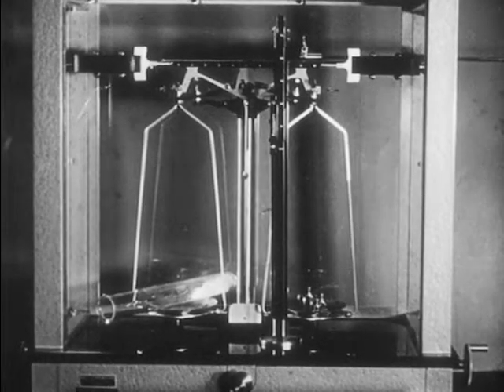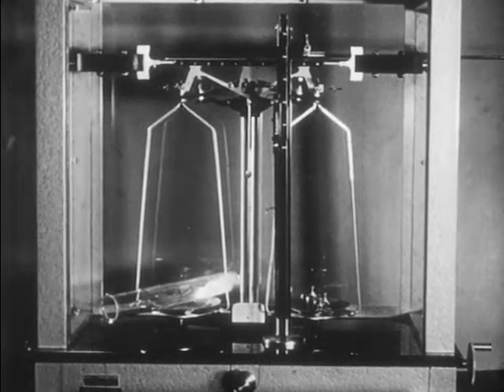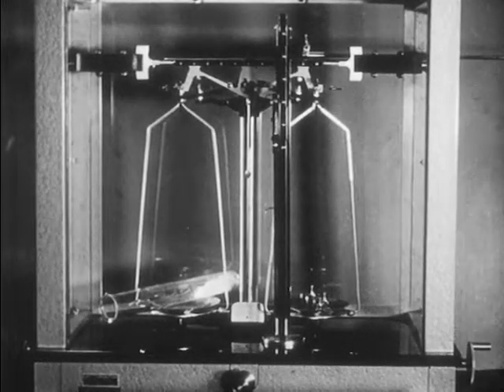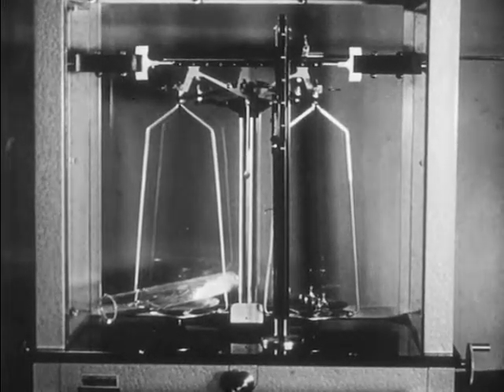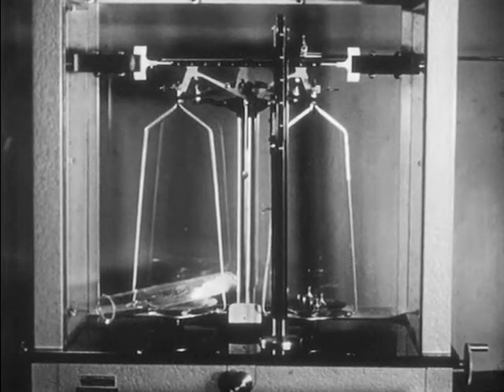The tube containing the sample of urea has now been reweighed and found this time to weigh 43.885 grams. This means that the sample of urea taken weighs 4.228 grams.